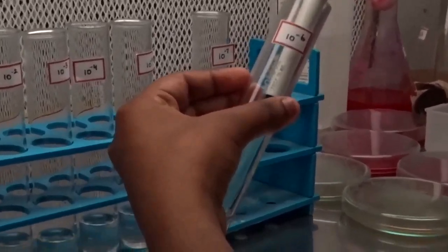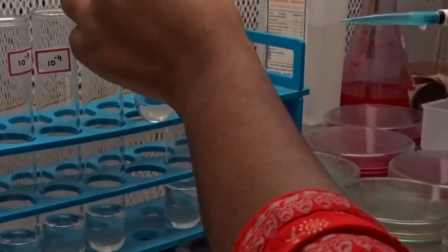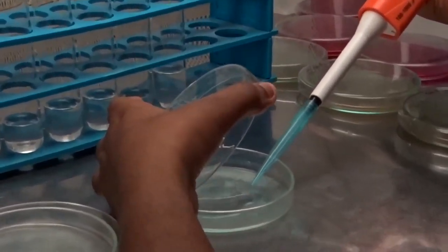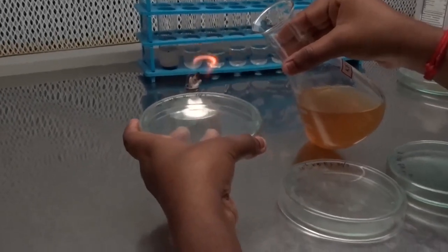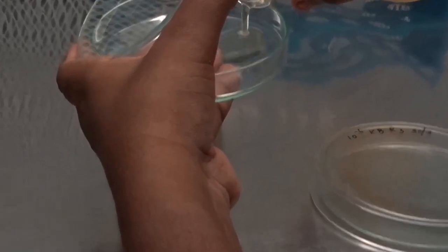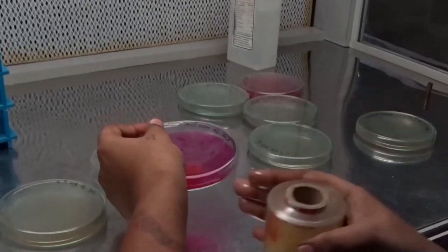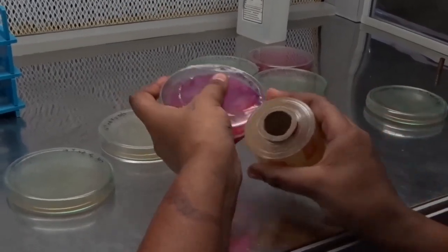Choose 10 to the power minus 6 dilution for isolation of Pseudomonas. Transfer 1 ml of suspension to a sterile petri plate. Heat the mouth of the flask and pour 15 ml of molten and cooled Kings B medium to a sterile petri plate. Wrap the petri plate tightly using cling film.